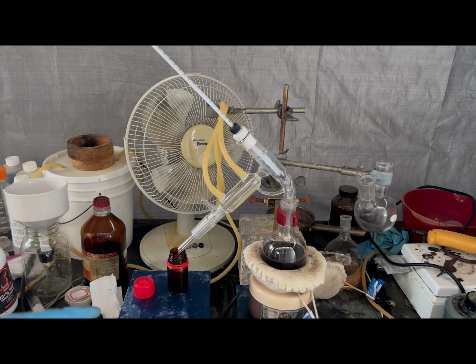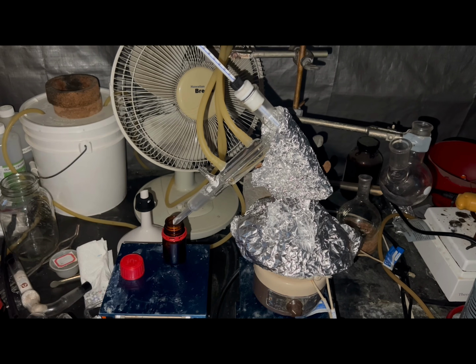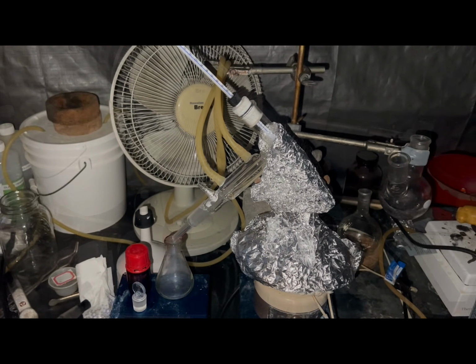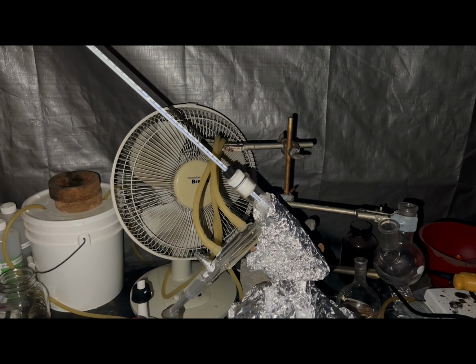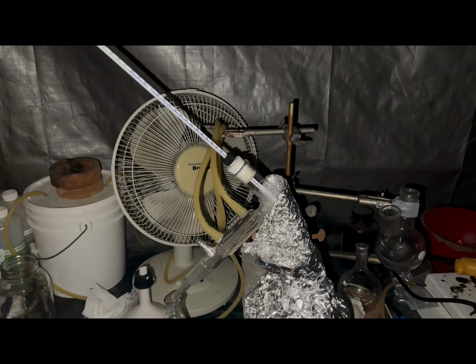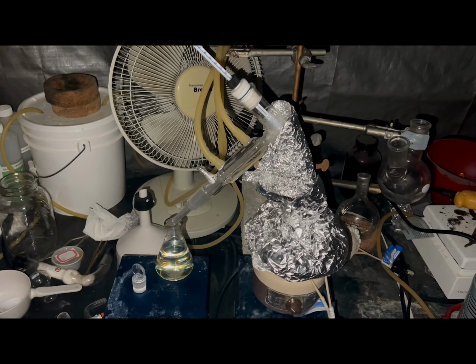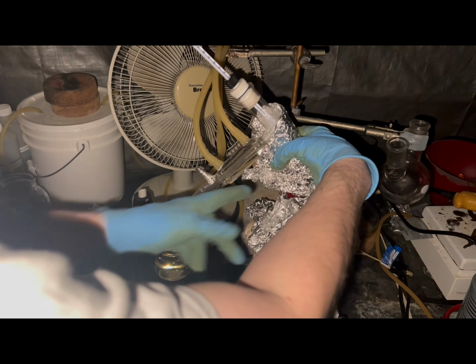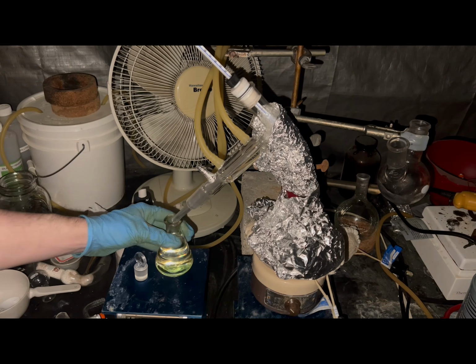Once an hour passes and I wait for it to cool down a little, I add the product mixture from a previous smaller run. Then I set up for short path distillation. I thought some unreacted thionyl chloride would distill over before the benzoyl chloride, but because I didn't freshly distill it to purify it before the reaction, there was no unreacted thionyl chloride. This reduced my yield, but I was able to recover most of the unreacted benzoic acid.